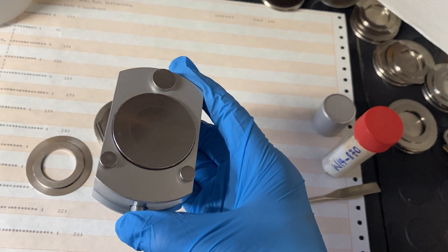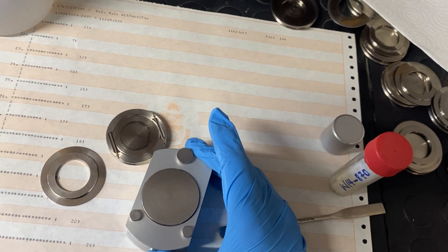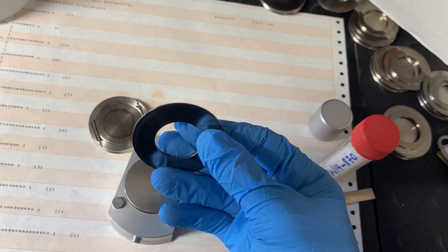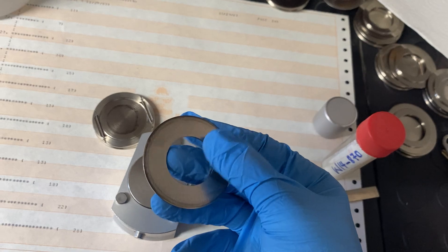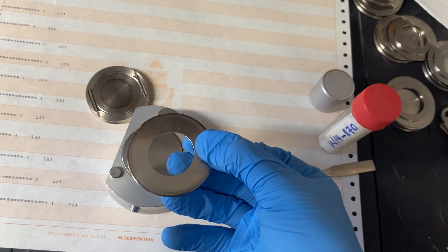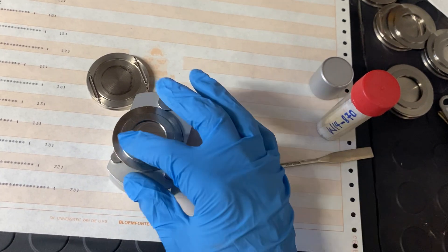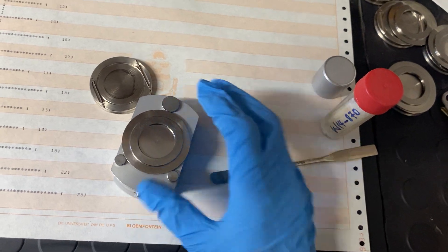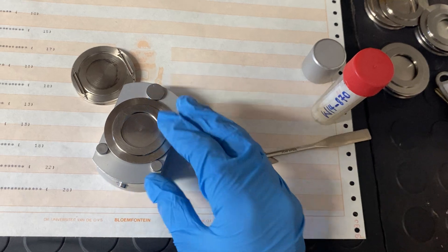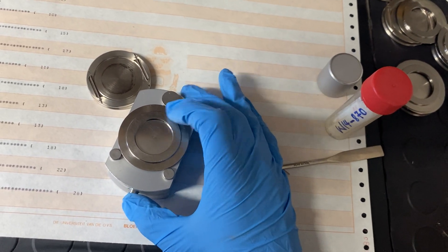If the piece inside has been moved, ensure that the flat side of the top part of the sample holder is facing down. You put it like this and make sure that it moves. Then you carefully lock it in place by pressing the button. And then it is locked in place.